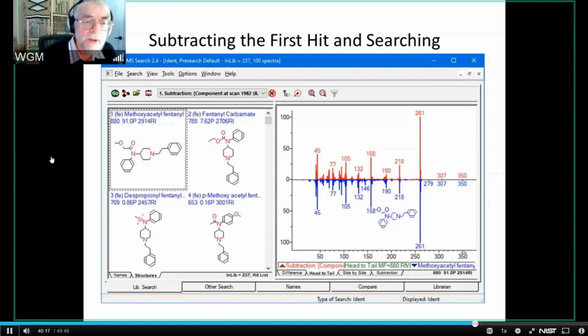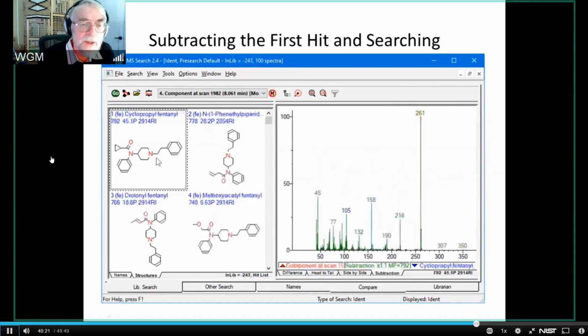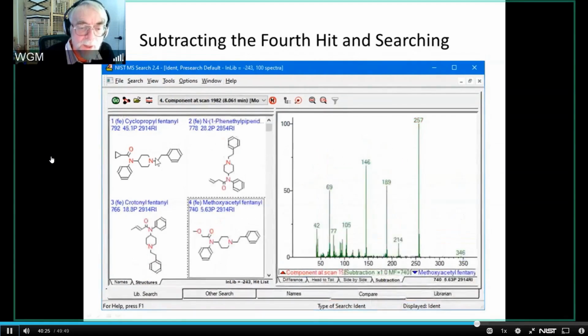One of those components is methoxyacetylfentanyl, and one of those components, and this is the thing that's a little bit confusing, let me go back to the very beginning when I had all four of these things, is something else, and it's not really clear what. But this is, again, one of those places where, just to go back to something else Ed talked about, the retention indexes can help us a little bit.